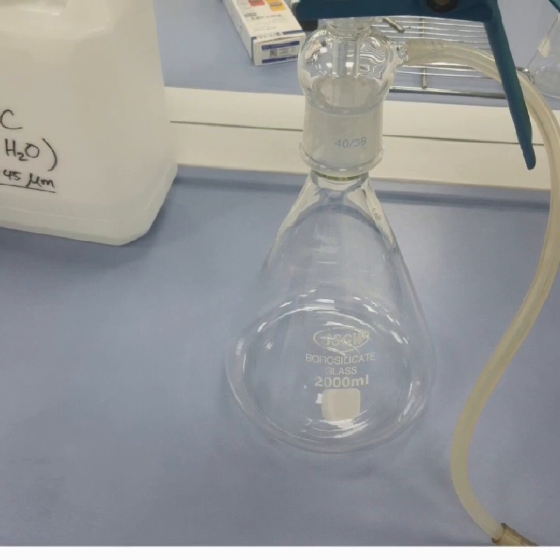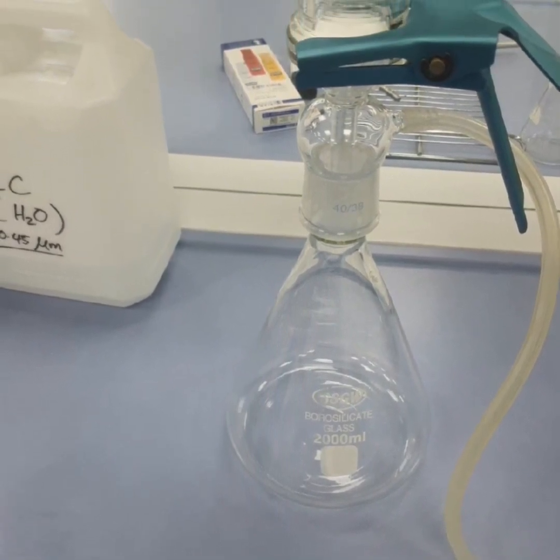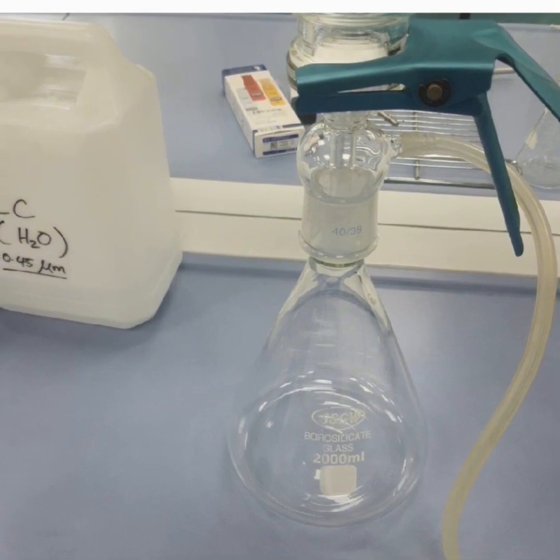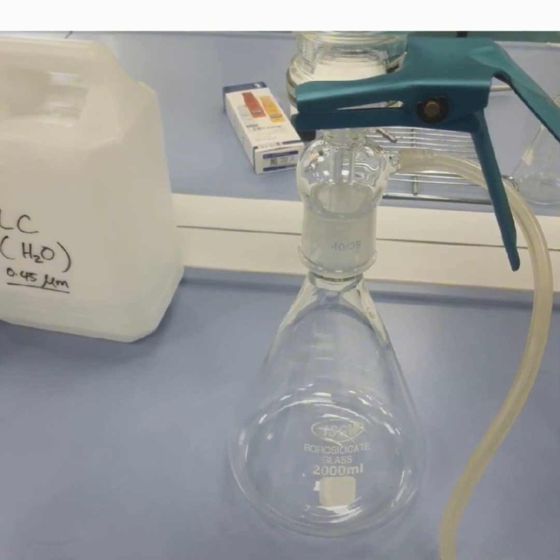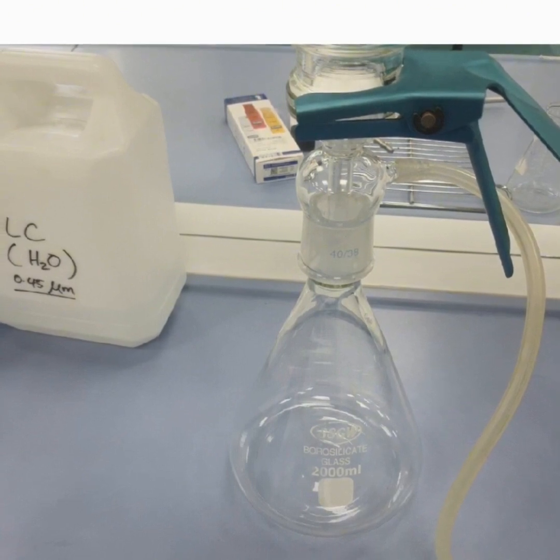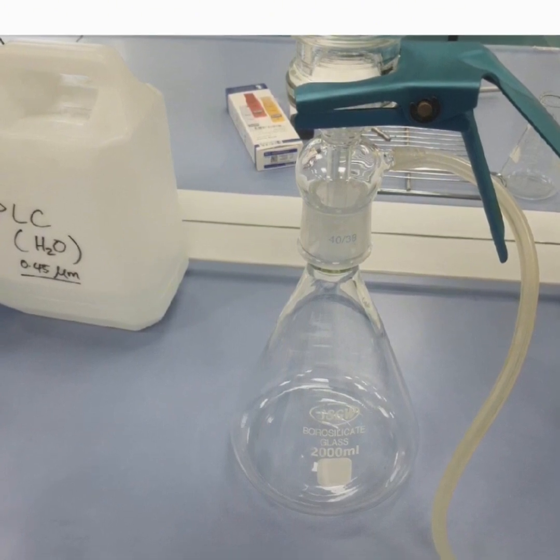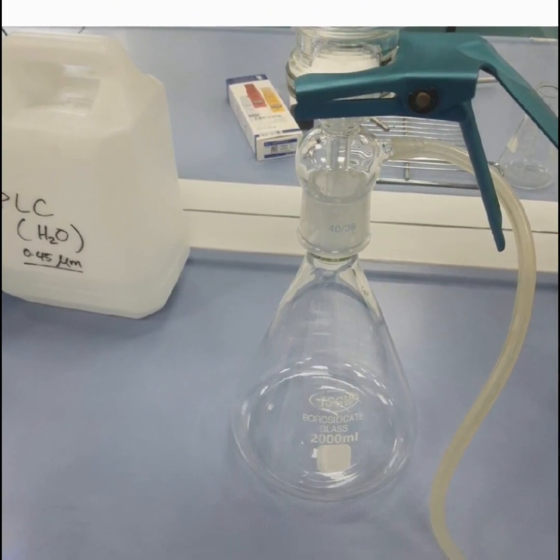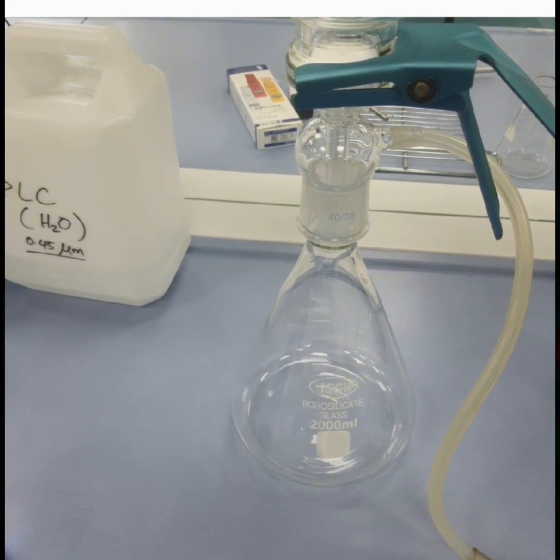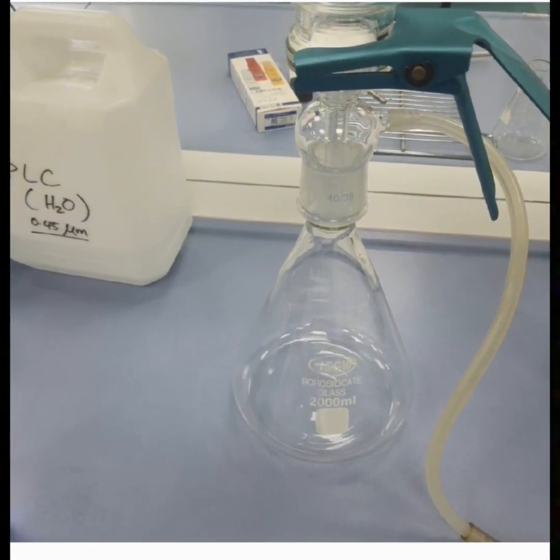Here the vacuum creates a driving force that pulls the liquid through the filter while the solids cake on the outside of the filter. Now what does the filter do? The vacuum filter basically traps the dirt and other particles from being expelled into the other sources.